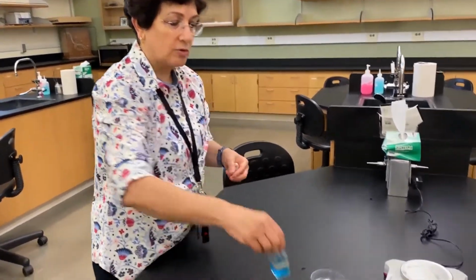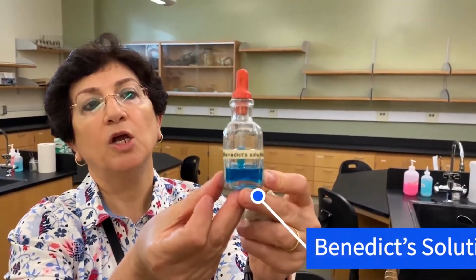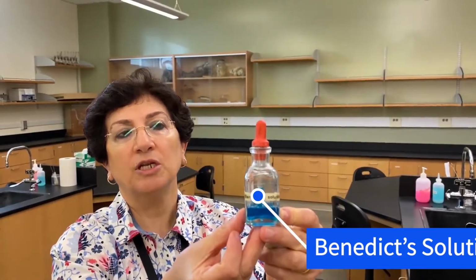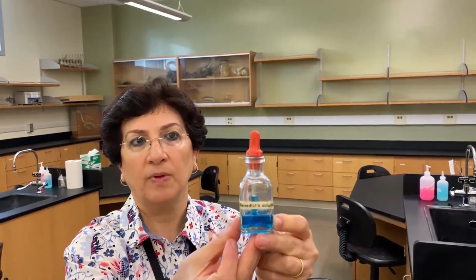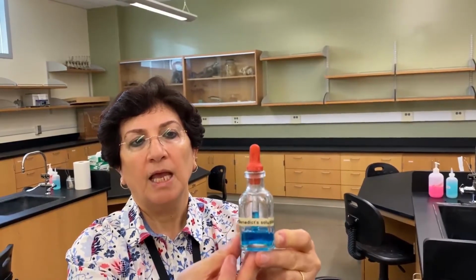We have one solution. As you can see in here, it's really that nice blue color. We call it Benedict's solution. And this solution is used to test for the presence of glucose or simple sugars in general. Once we have our experiment going on for a couple of hours, we're going to do our testing, and there is going to be a color change.